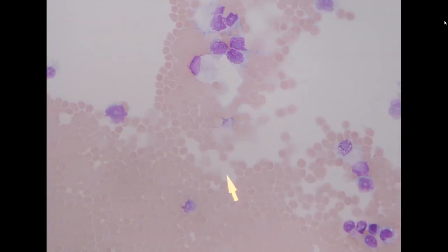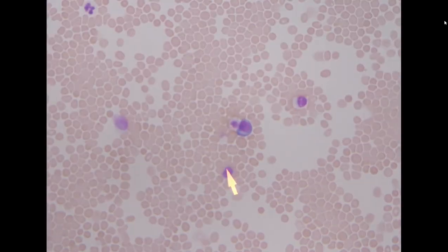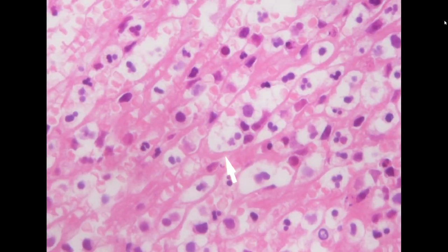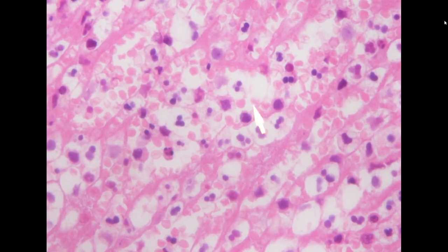Although the cellularity is not so high and the cellular preparation is not optimized, we can still identify these as malignant cells. It is compatible with the patient's history of large B-cell lymphoma, and this is the cell block preparation. You can see the majority of the cells are single cells and not in clusters. And here are some marked degeneration, but there are still some enlarged single cells over here. So this is positive for lymphoma.